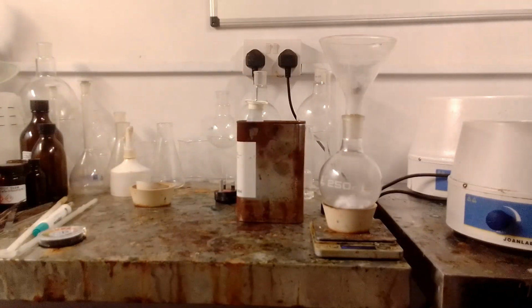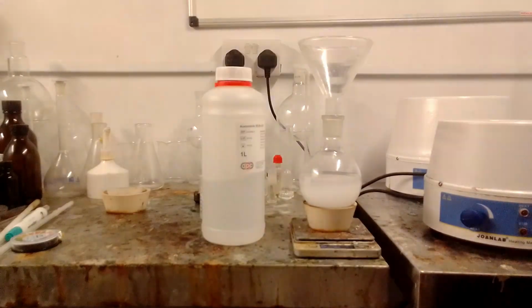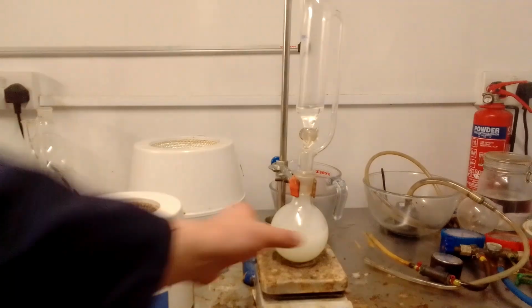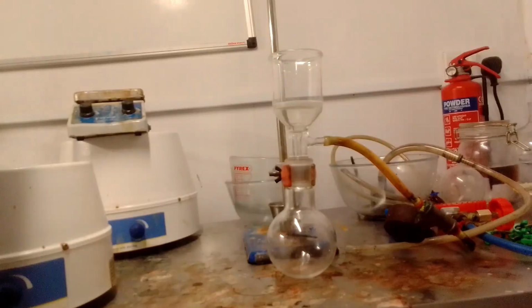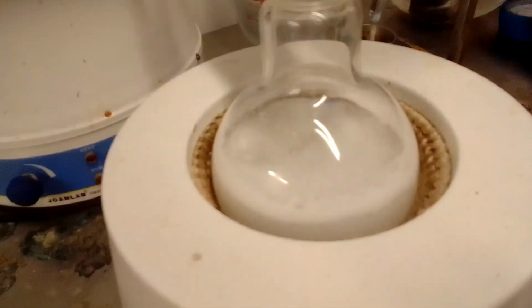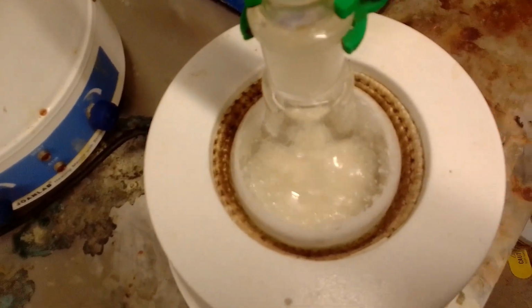Salicylic acid and cyanuric chloride were dissolved in THF, diluted further in acetonitrile, and triethylamine was added dropwise. Once addition was complete, the mixture was left to stir for 2 hours, then it was filtered by vacuum. Most of the solvent was removed from the filtrate by distillation. The distillation was stopped when around 40-50 ml of liquid-solid mixture remained, and it was clear that the solvent was boiling off entirely from the surface.